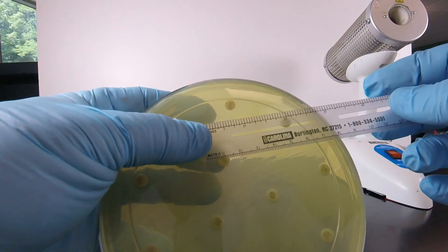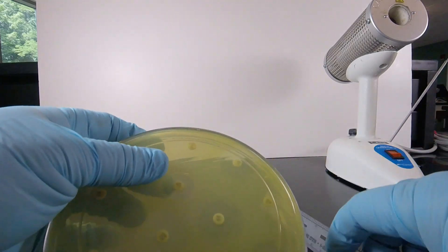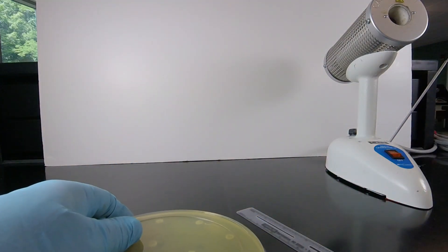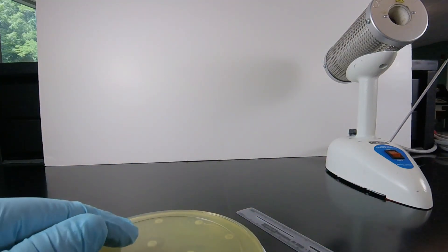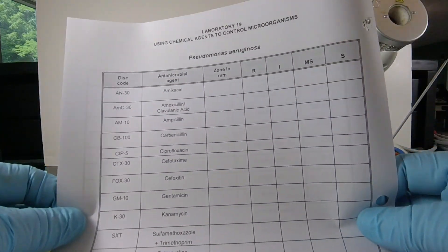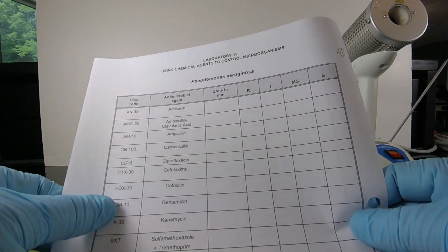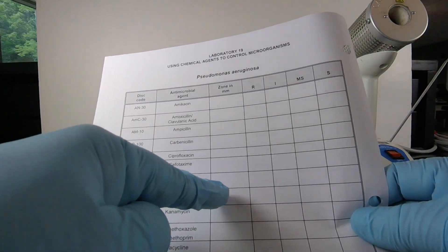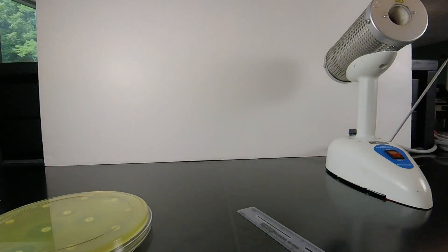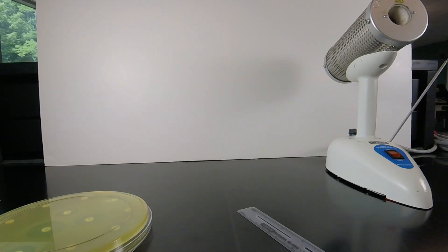For gentamicin, labeled GM10 on the disc, we go to our results page for that bacterium, find gentamicin GM10, and write the diameter there — which in this case was 19 millimeters.